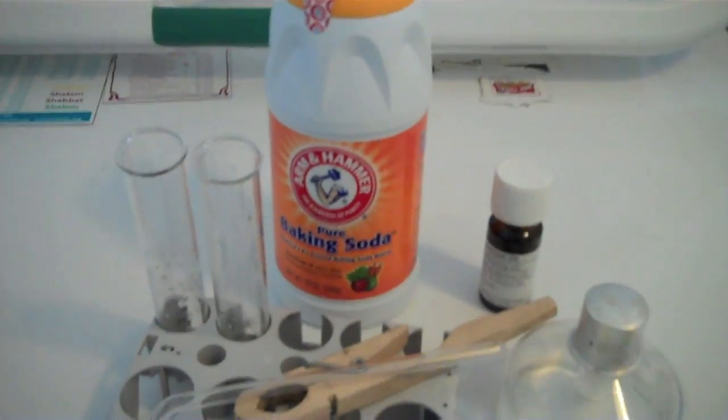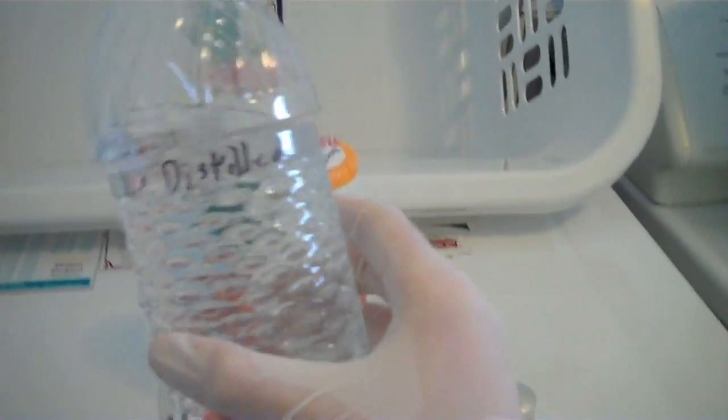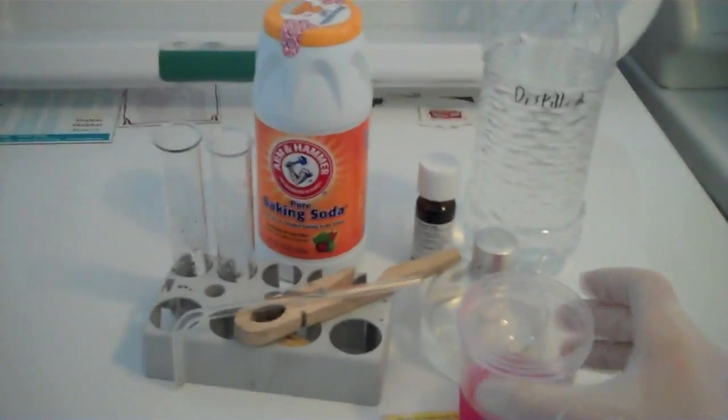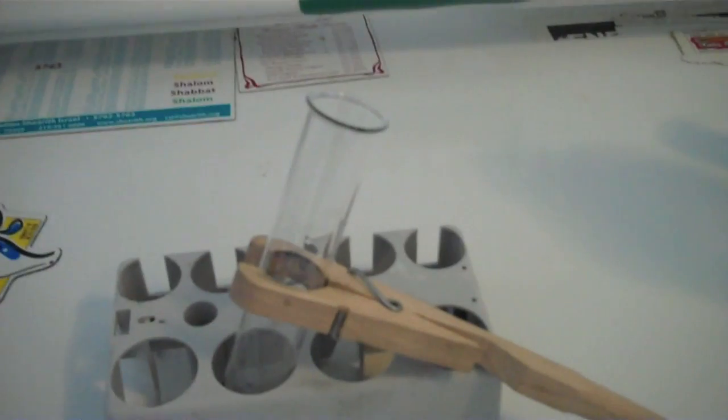An alcohol burner or any source of heating, some distilled water, and also optional like the litmus solution, a pH indicator.